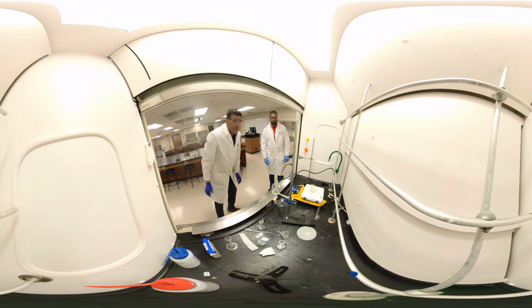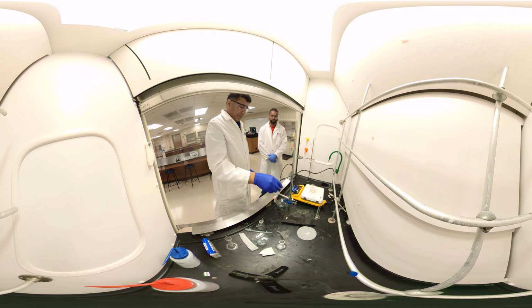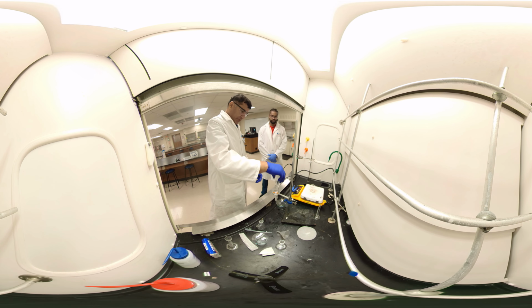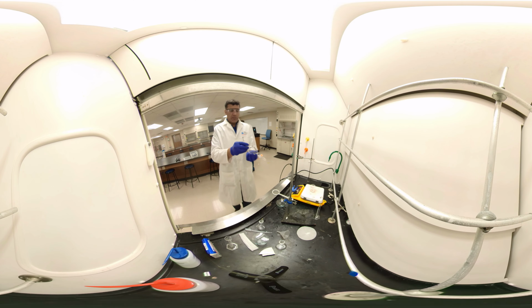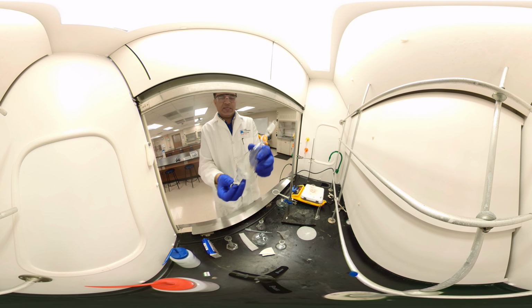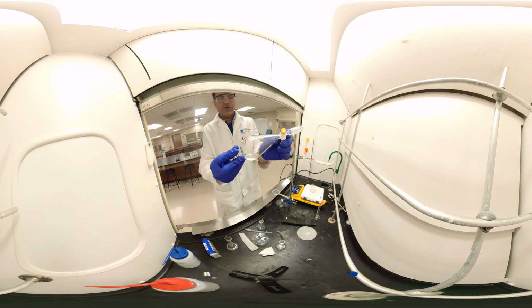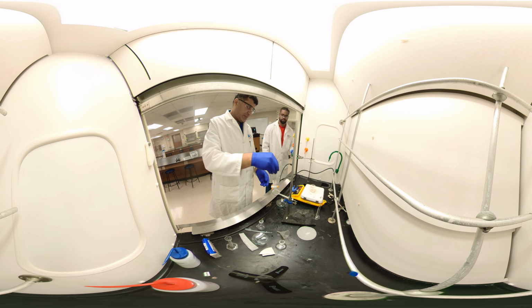And the dichloromethane is the bottom layer. We have to swirl it and keep venting. And let me show you how to do it anyway. Our O-ring is kind of small, so you just keep venting, keep swirling like this, but keep venting. Make sure it's closed. You heard the sound? That's the air pumping out, okay? Vent it. Now done. Put it back here.